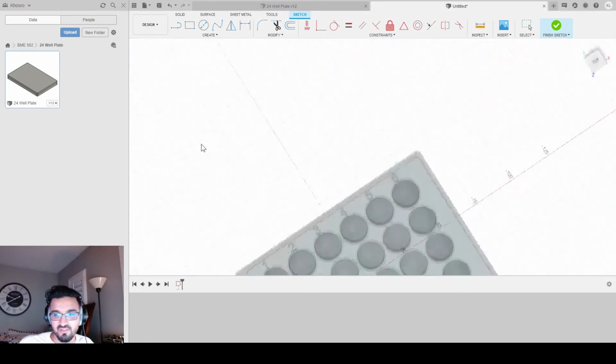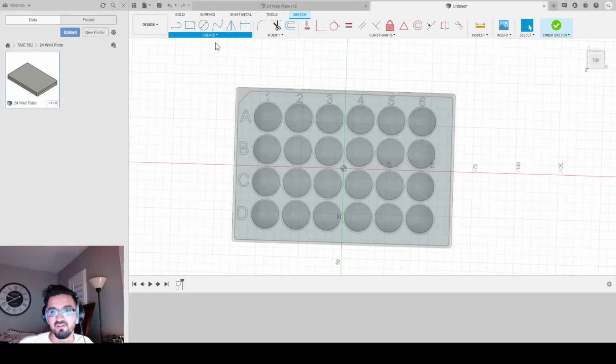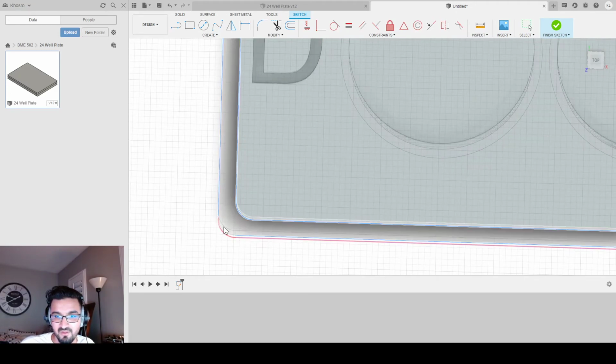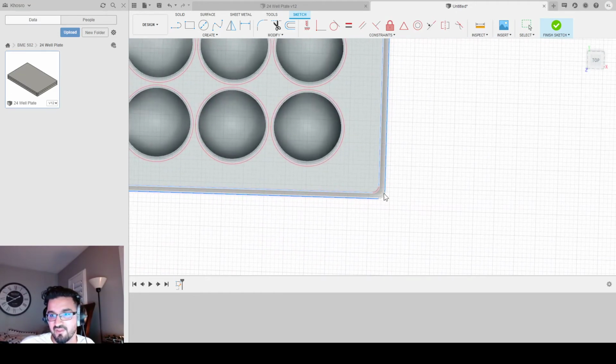Now, there is a shortcut we could use here to kind of make our life easier. And it's called project in our sketch mode. And all that does is project the things in other sketches onto this sketch. And that's what we want to do. So let us project everything underneath, at least when it comes to the outer surface of our plate. And notice how it didn't get the corners. That's because you got to zoom in and actually select them. Right? So let's make sure we select everything.